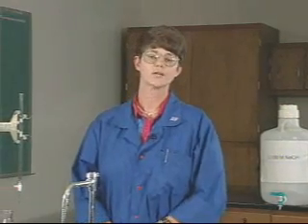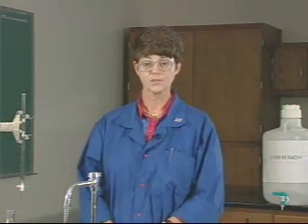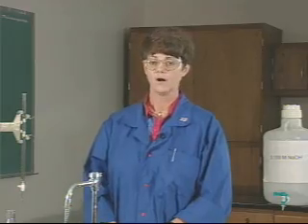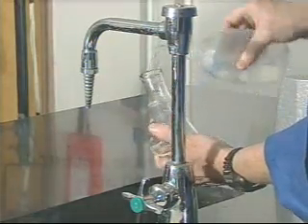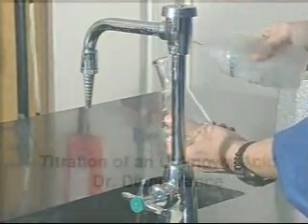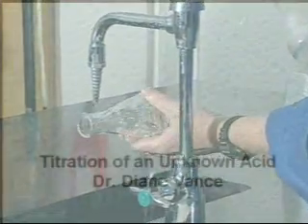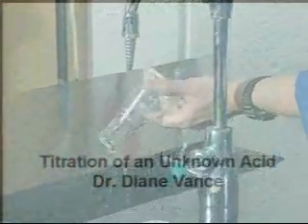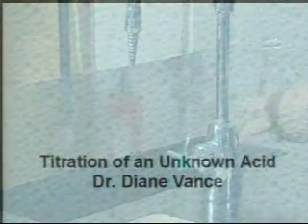After you have completed the calculations and met the required relative average deviation, you can then clean up. All of the solutions that you've used today can be disposed of down the drain. Make sure that you rinse the burette and the flask well with distilled water when you're finished.